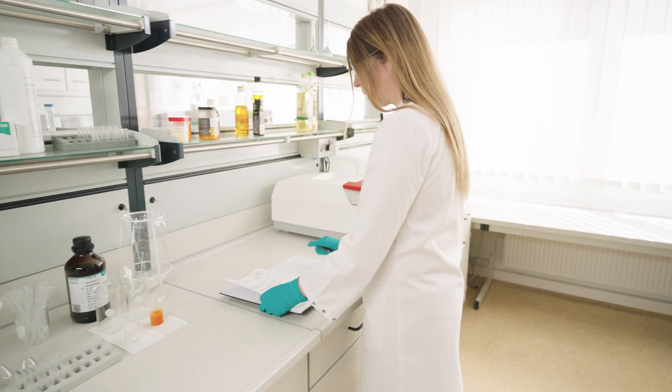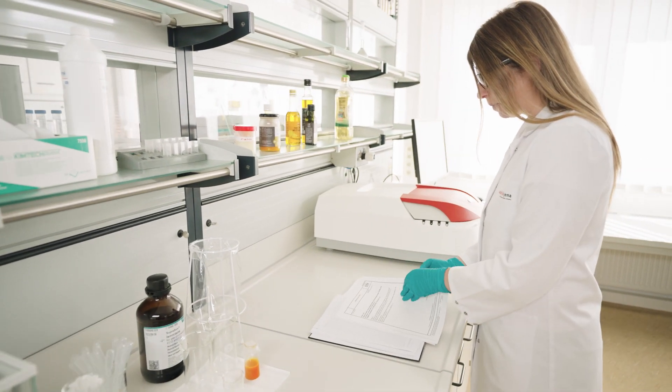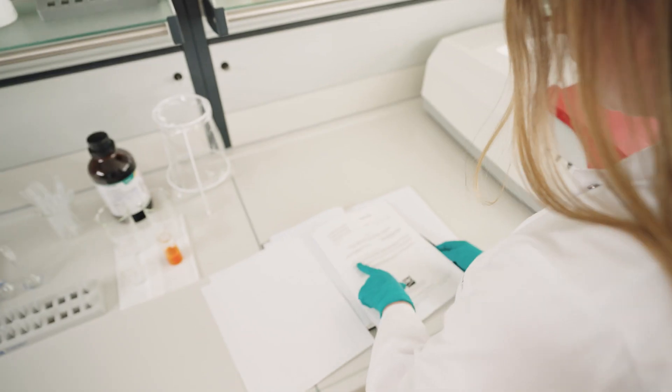Apart from compound concentration analysis, UV-Vis spectroscopy is a well-established tool in several industries, for example, process monitoring based on standard parameters such as color analysis. But let's go back to our oil analysis and especially to Sandra. She will guide us through the whole workflow from the sample preparation up to the data analysis.